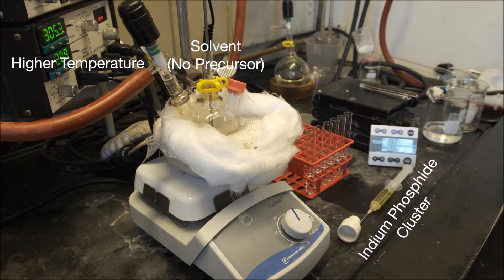This is because indium phosphide is highly sensitive to oxidation, and incorporation of water in the synthesis has been demonstrated to affect the growth of these nanoparticles. Lastly, we're using indium phosphide clusters to be hot injected via the syringe. The reaction flask currently contains a high boiling solvent but no other precursors.